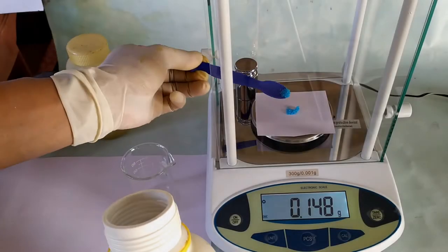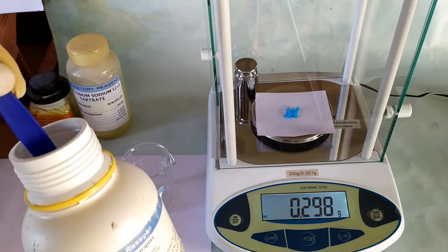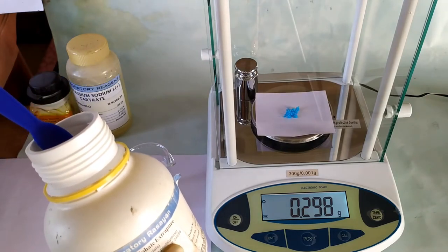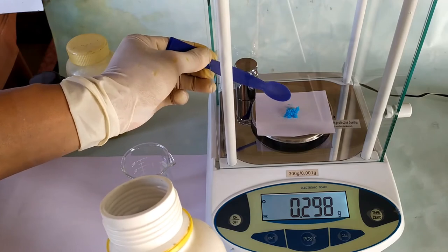To begin preparing the reagent, first weigh exactly 0.3 g of copper sulfate pentahydrate and transfer it into the beaker.